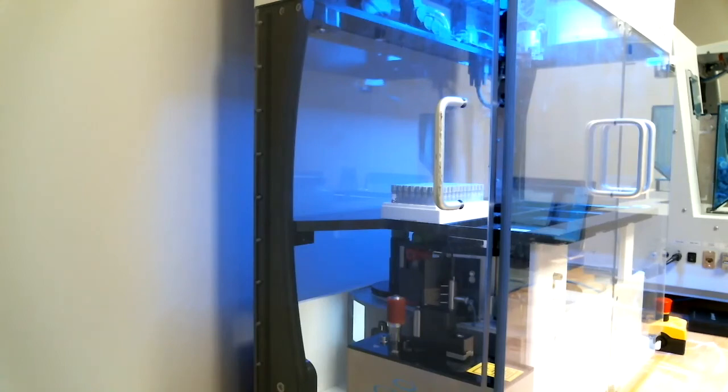There isn't really much daily maintenance to do. We suggest that every time you change out a roll of labels and ribbon, that you give the unit just a little bit of a wipe down, wipe down the deck rack. There are some rollers in there that it's good to take an alcohol wipe and wipe down, just because there is a chance that they can get a little bit sticky from the label residue. And then there's also rollers in the print head that need wiped down, but that's very easy, and there's step-by-step directions on how to do that.